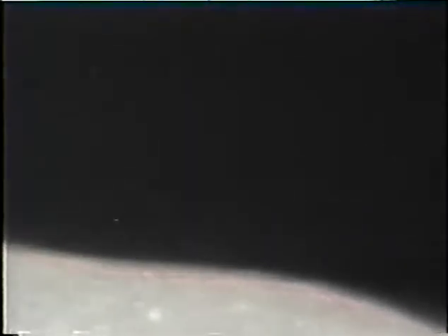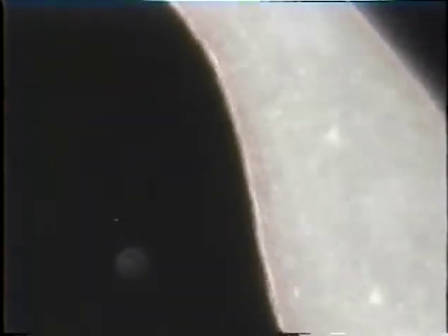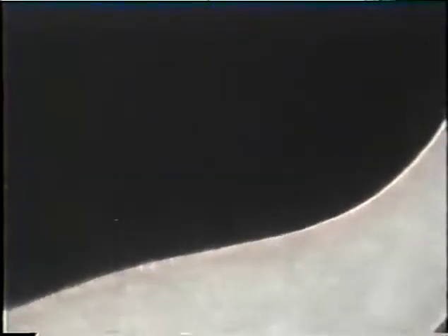This is another blepharisma. This particular video was made with my new condenser. It's made in Russia. And it has a much better quality and sharper resolution.